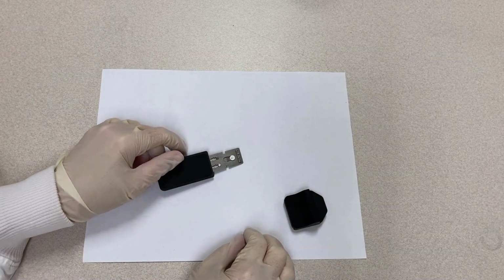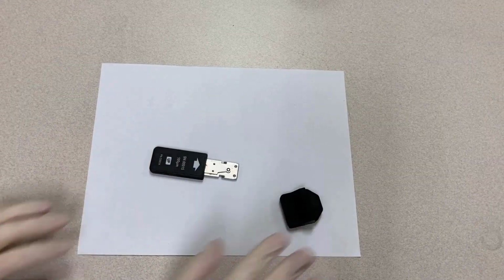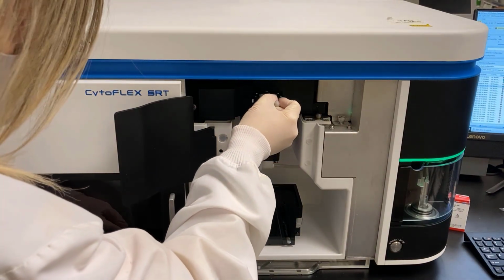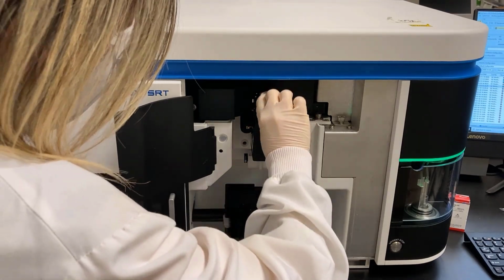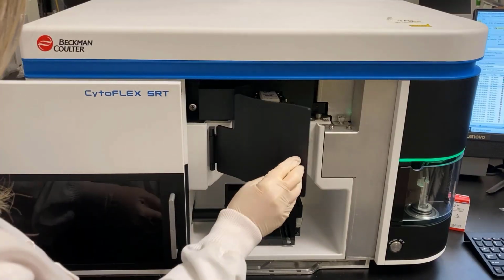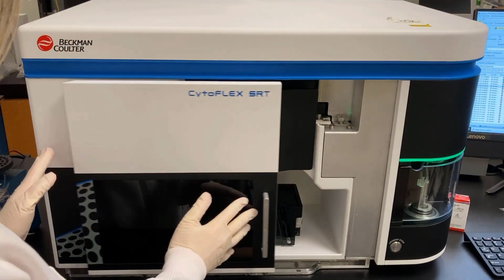Insert the nozzle module carefully into the sorter with the up symbol facing up. The nozzle module is locked into its position when you hear a click. Close the sort protection door. Close the sort chamber sliding door.